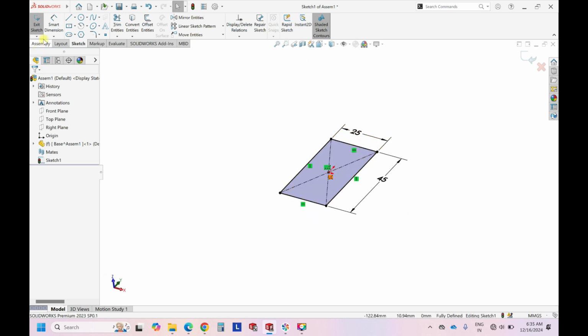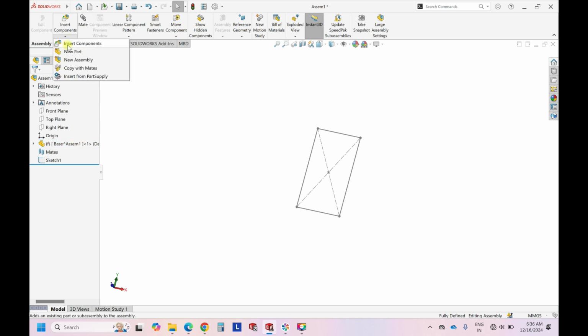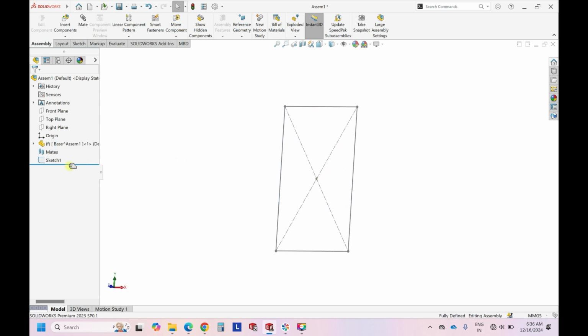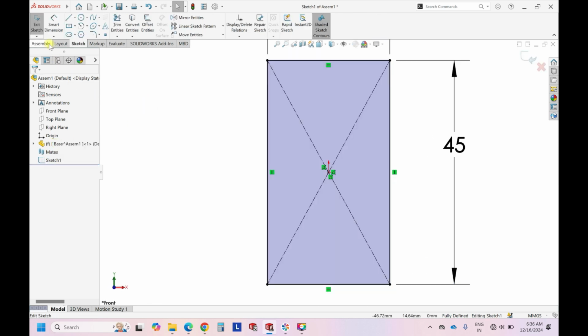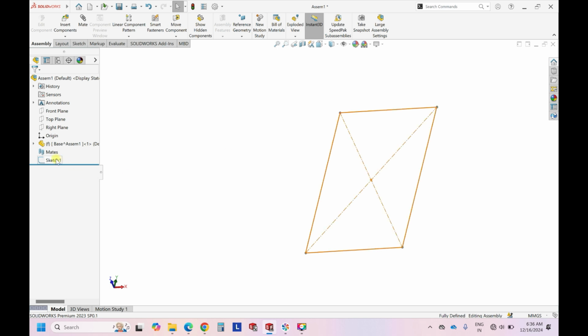Okay, once the sketch is ready, if you see, I have made a mistake over here. This is because past viewers have asked about mistakes over there. I have inserted a part and renamed it, but the sketch is not inside this part, it is outside this part. It means that this is in the open space of the assembly. Please avoid this mistake, because if you do this, you will not see the features to extrude, or any 3D features, because it is assembly designing, so you cannot do that. The best way is to exit this, and then we can delete this sketch.